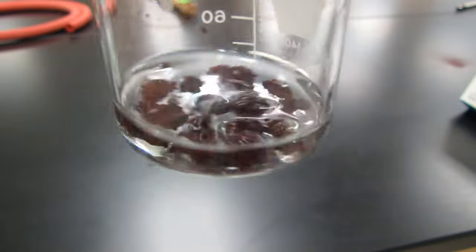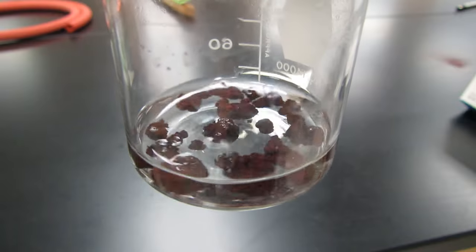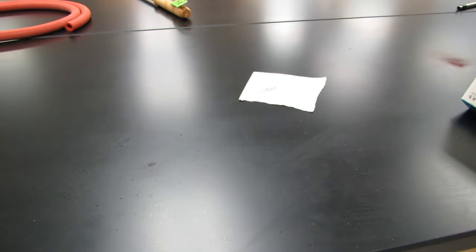Now what's this? Oh look, the copper that we started out in the beginning with is right back where we started it with, in the bottom of a 150 milliliter beaker.